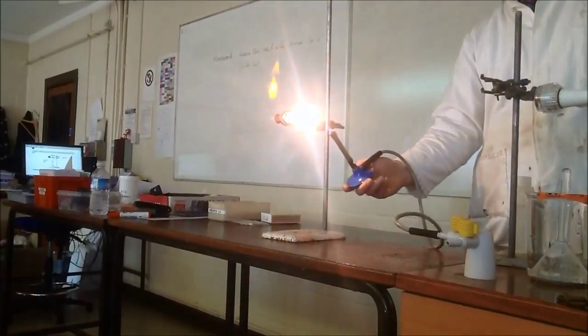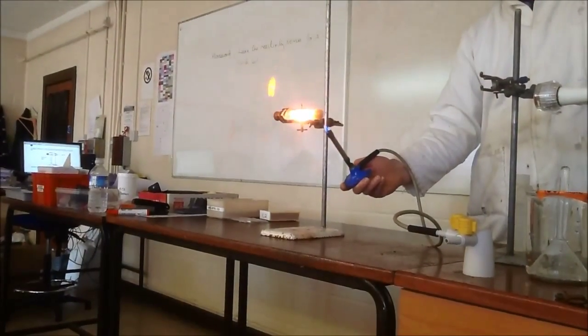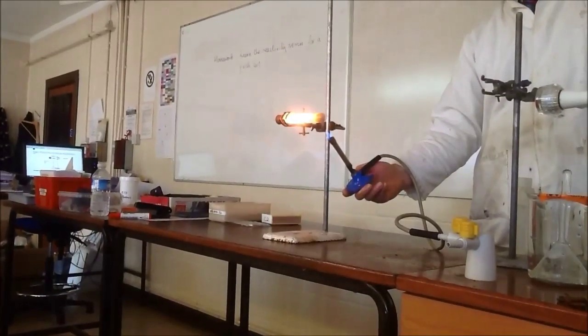There we go. Awesome. So lots and lots of white glow more than steam.